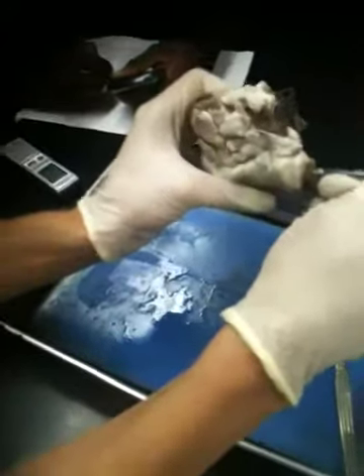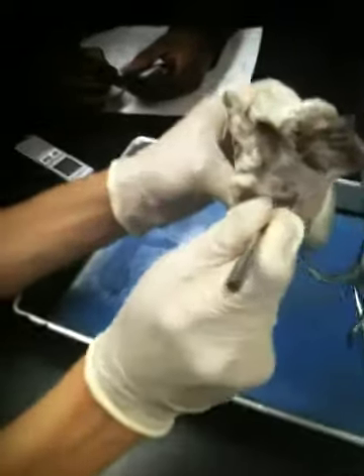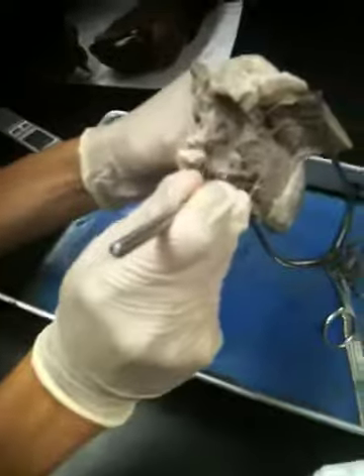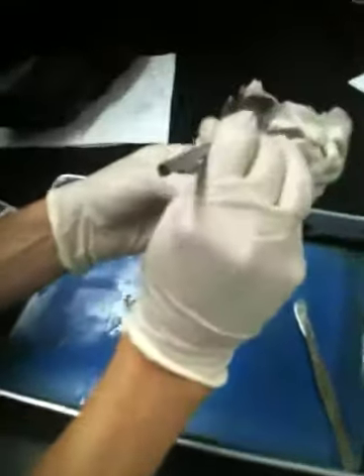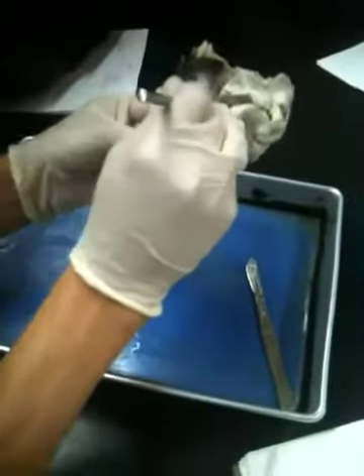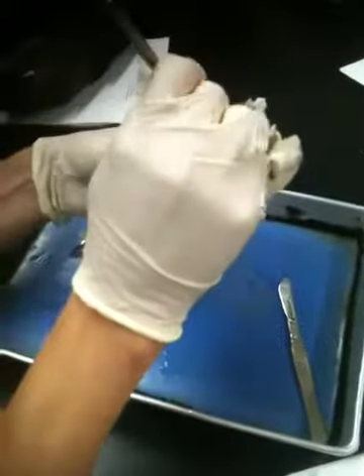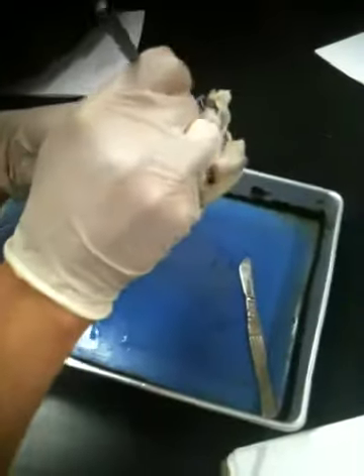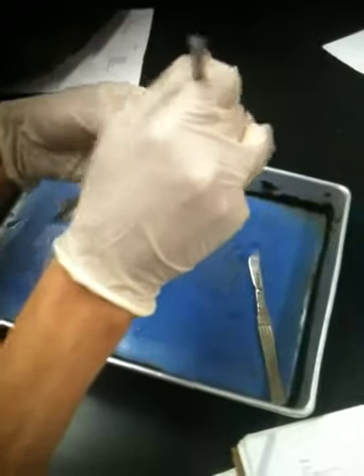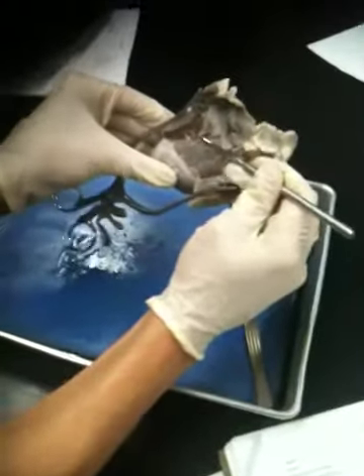Can you point it down? I can't see what you're doing. Right here. There's a protruding muscle down where I'm pushing it forward with the probe. At the end of the strings? Exactly right. The papillary muscles are always attaching to the chordae tendineae. So you could trace down any chordae tendineae and find a little projection of muscle and know that that's a papillary muscle. It just so happens that the biggest one is right here, and you can clearly see all of those chordae tendineae attaching to that one little projection. So that one little projection right here is one of those papillary muscles.